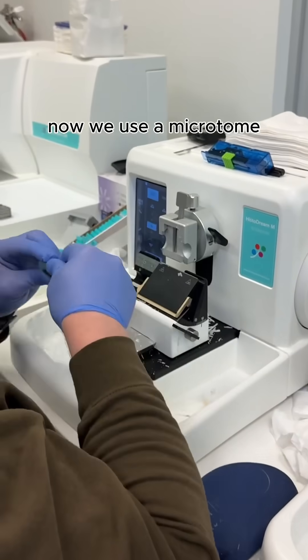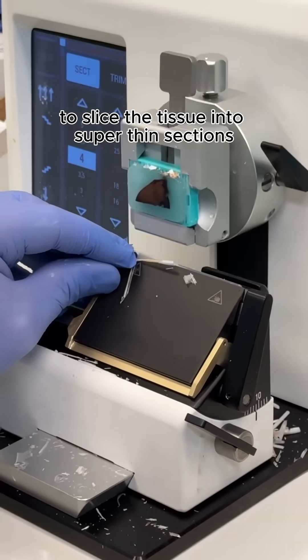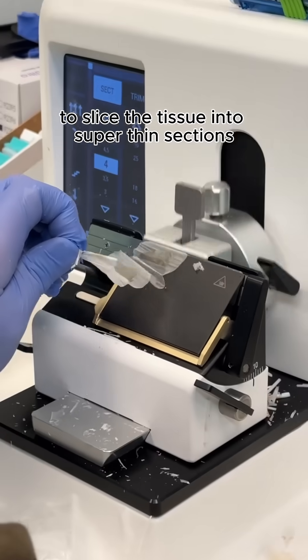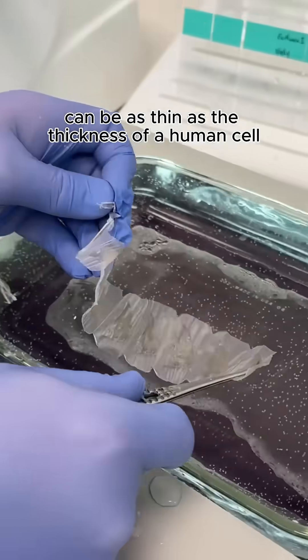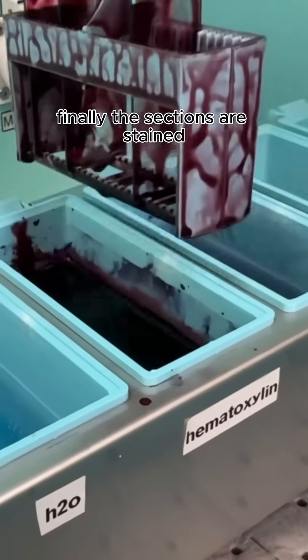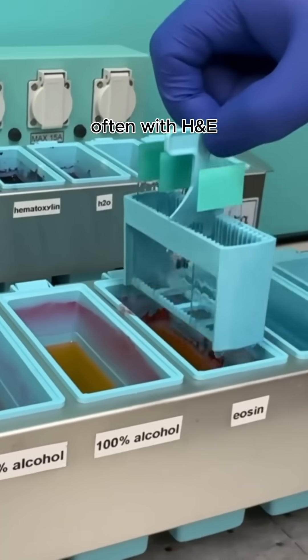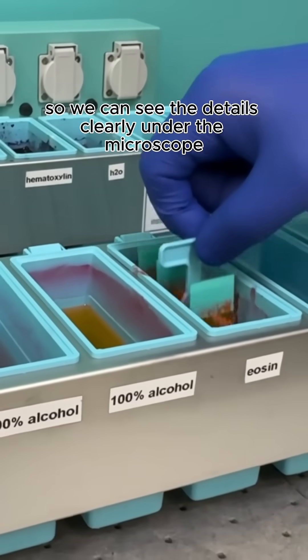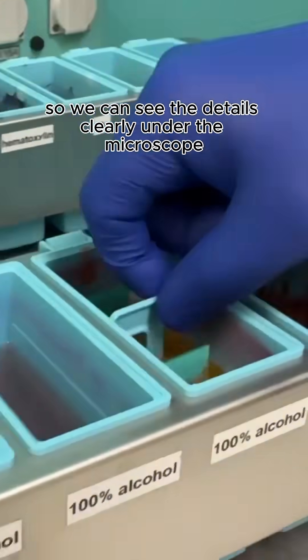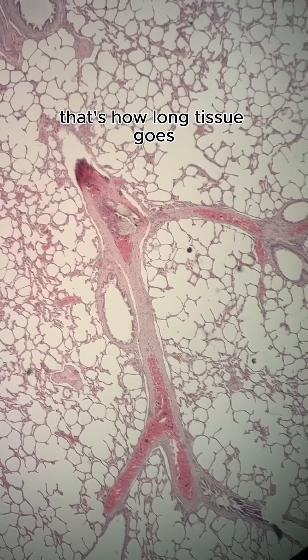Now, we use a microtome to slice the tissue into super thin sections. These sections can be as thin as the thickness of a human cell. Finally, the sections are stained, often with H&E, to highlight different parts of the tissue so we can see the details clearly under the microscope.